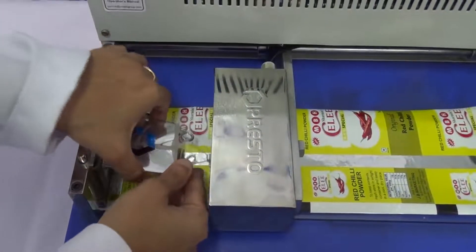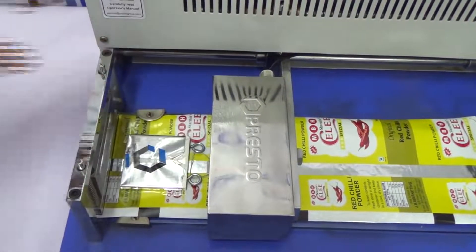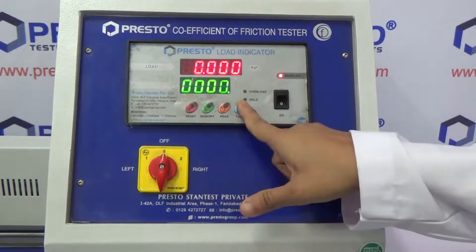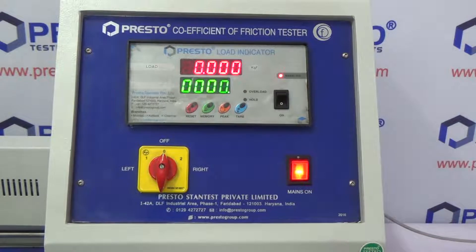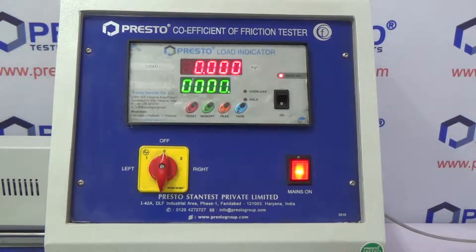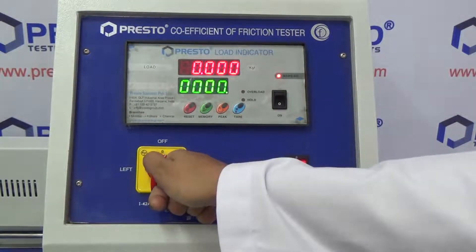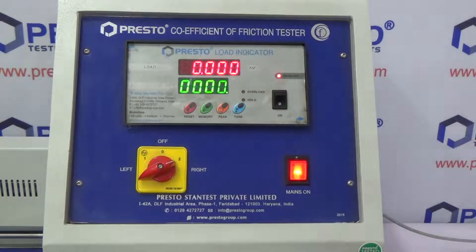Mount the sliding block. After placement of sample, press reset and zero to remove the values of the previous test.